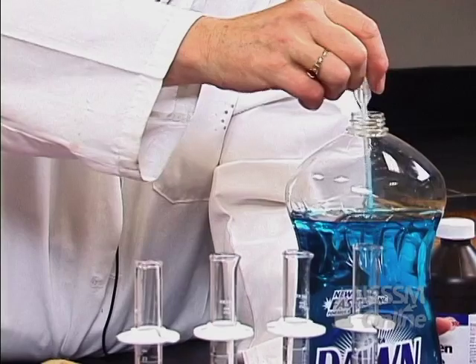What are the effects of surface area on a reaction rate? In this experiment we're going to look at the decomposition of hydrogen peroxide into water and oxygen gas.